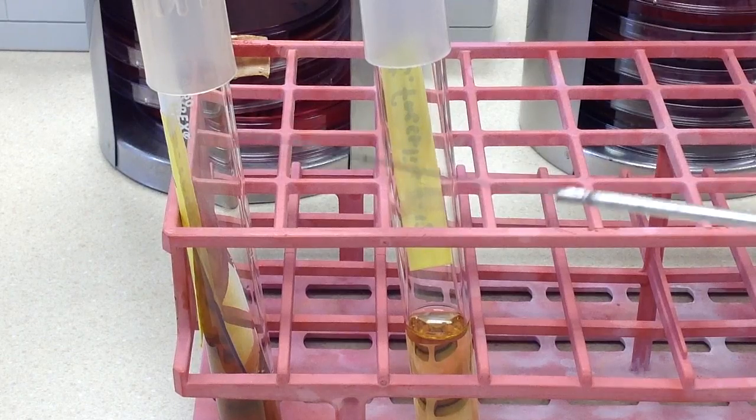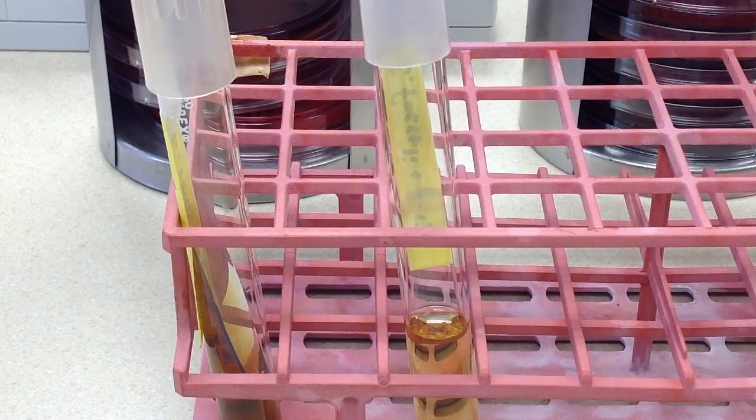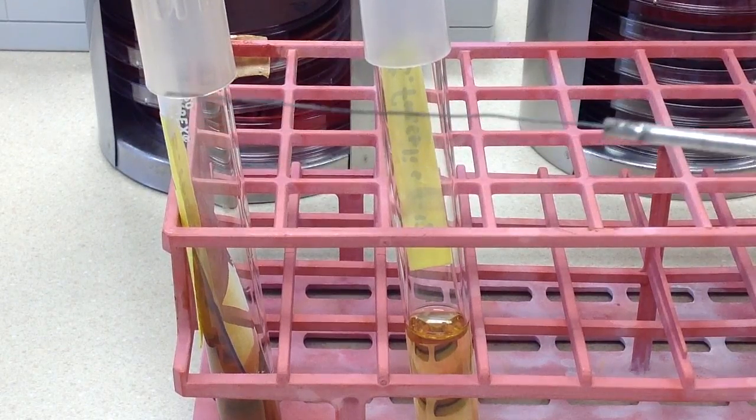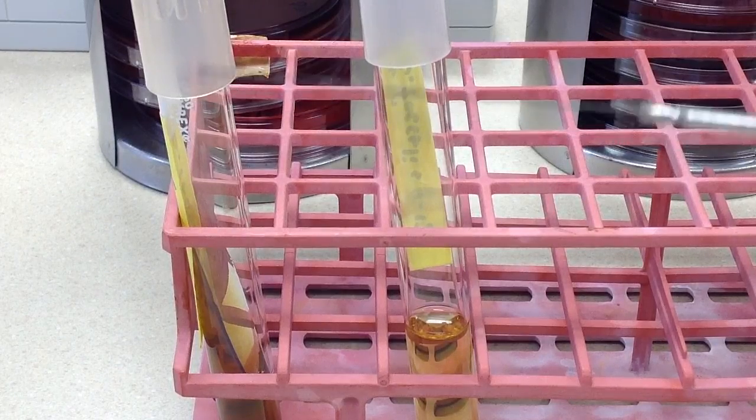Often times when we are inoculating tubes like this, we have to do a stab, and that is the main function of the needle.